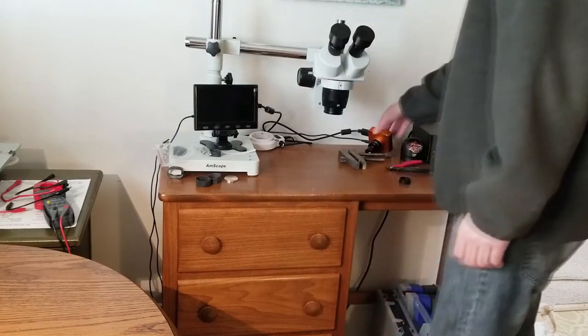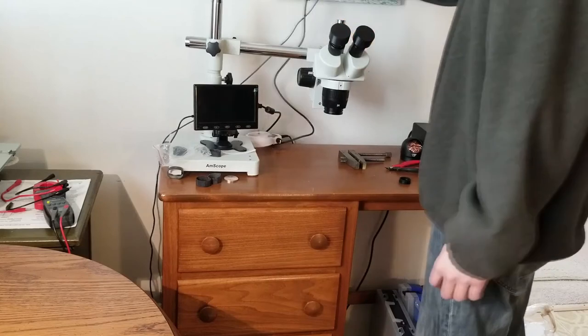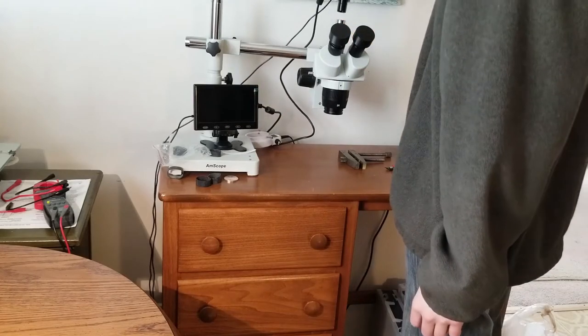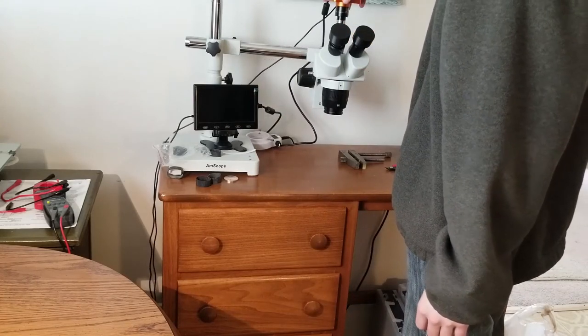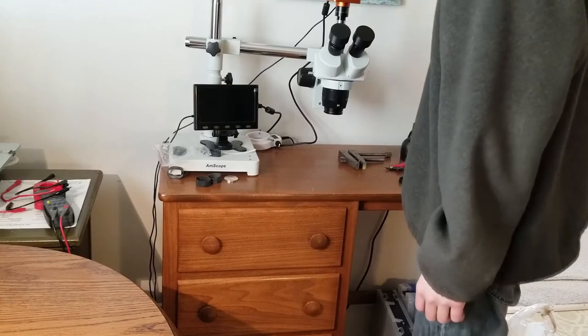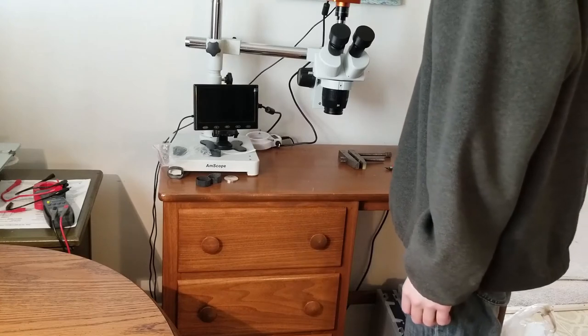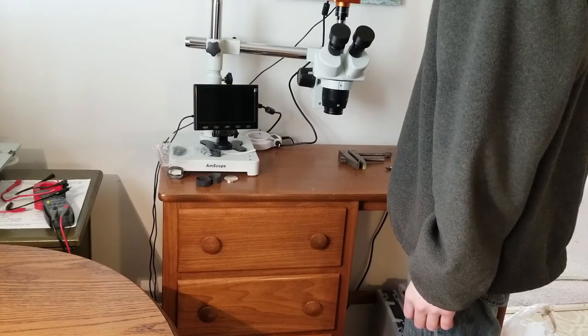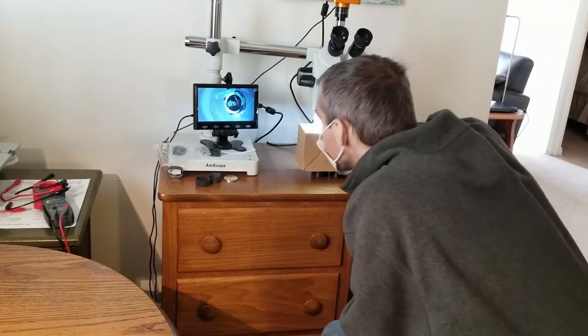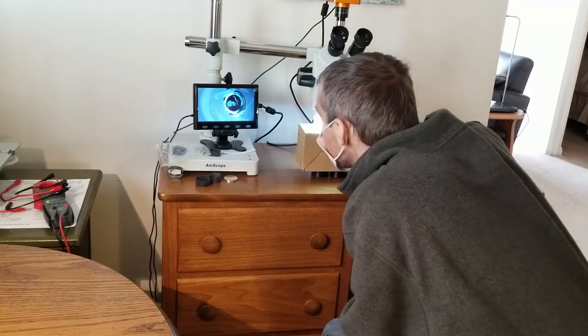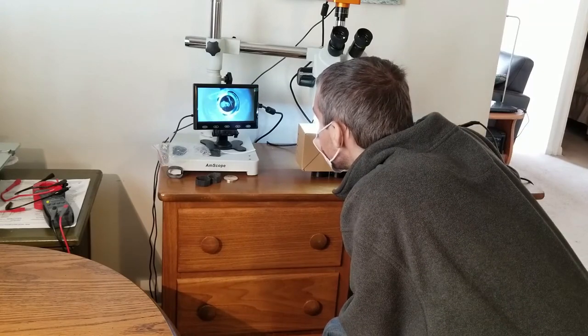And just a little bonus, I set my camera up and we can take a look at this LED light that I cut the top off of accidentally, or the top broke off, although you can't really see too much from the small screen I have there.